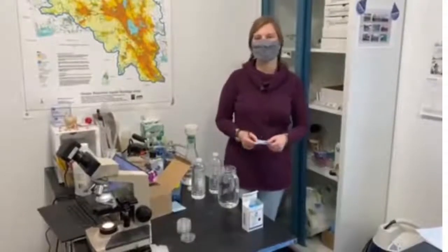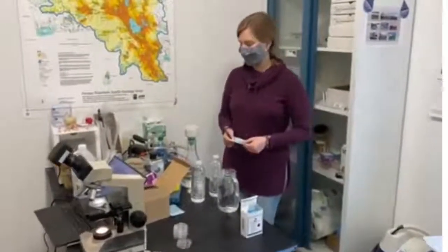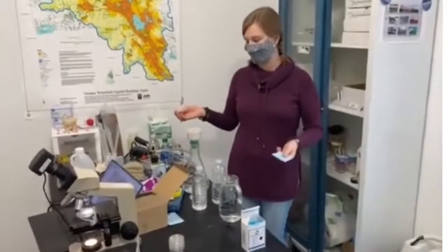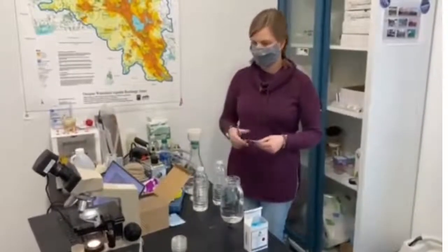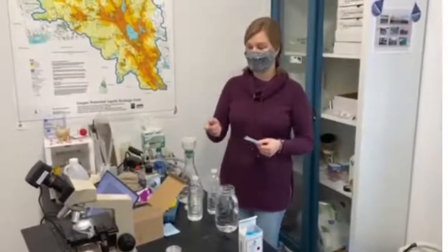Hello everyone! Today we are going to walk you through our process for taking microplastics and identifying them under the microscope.